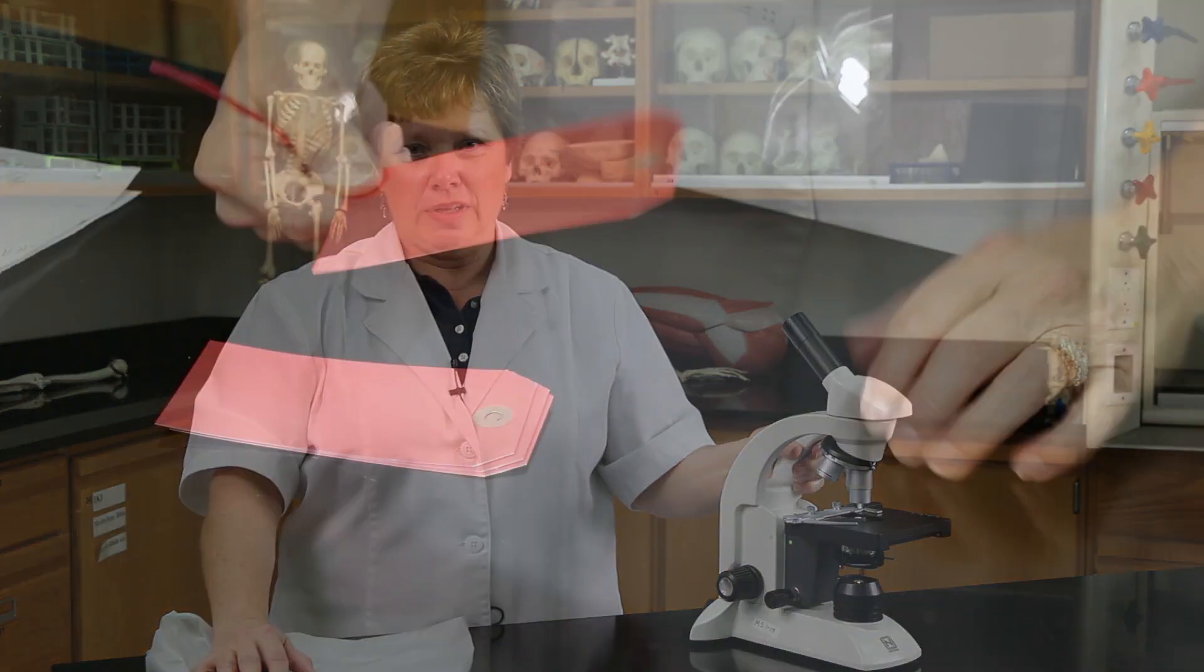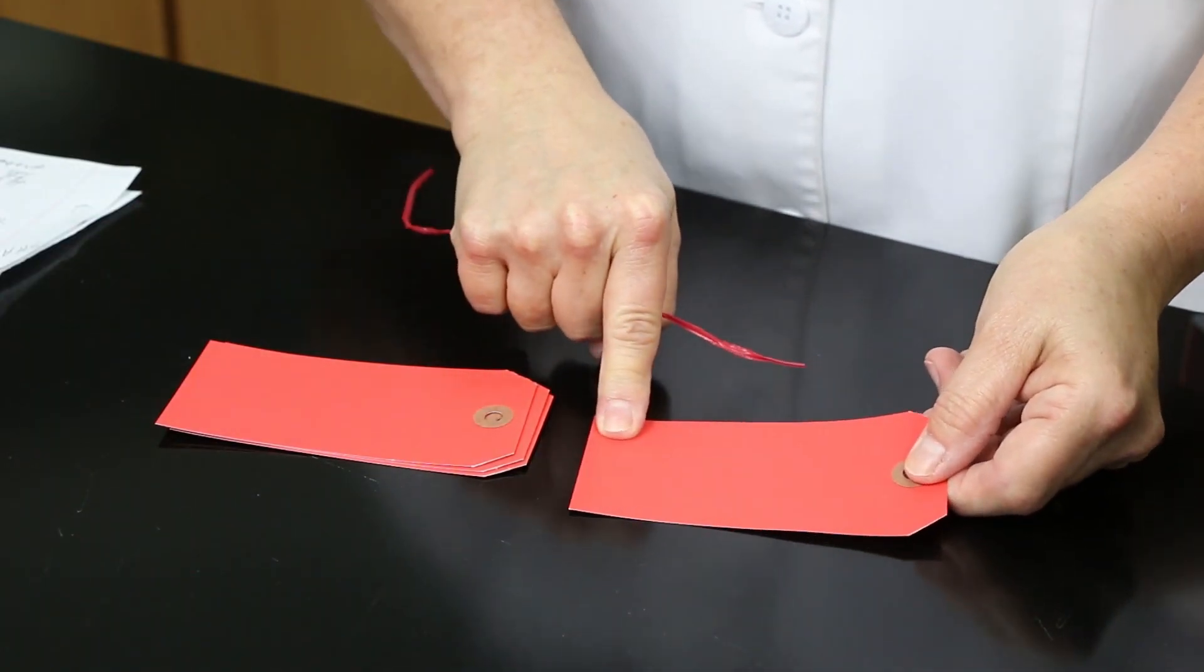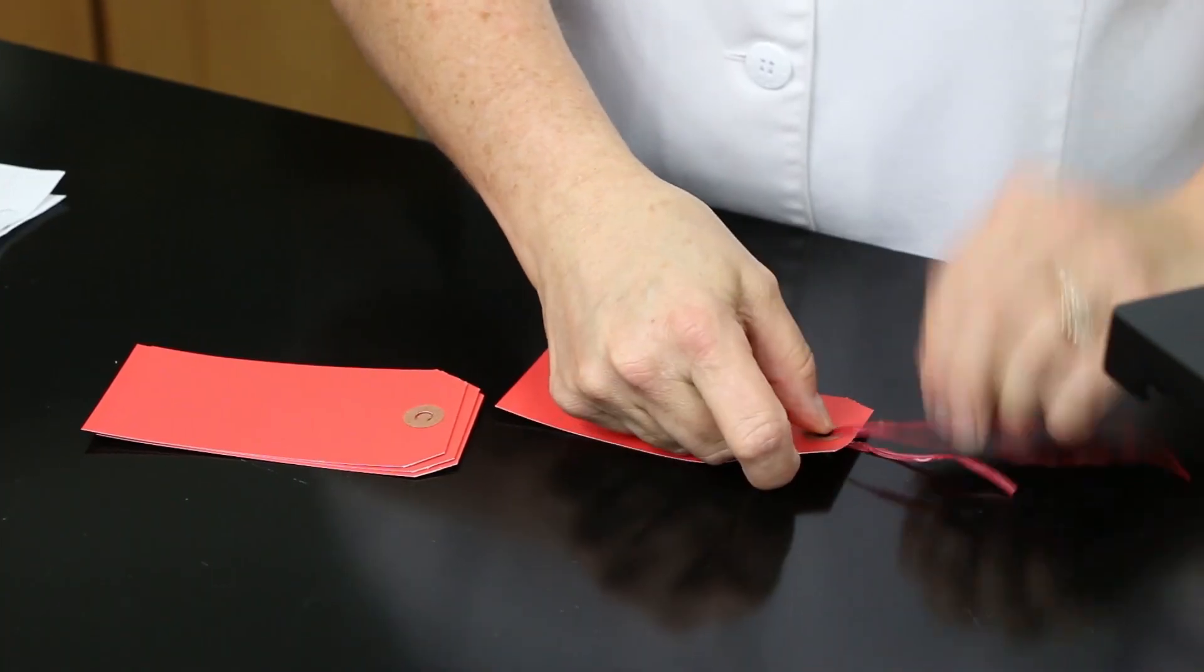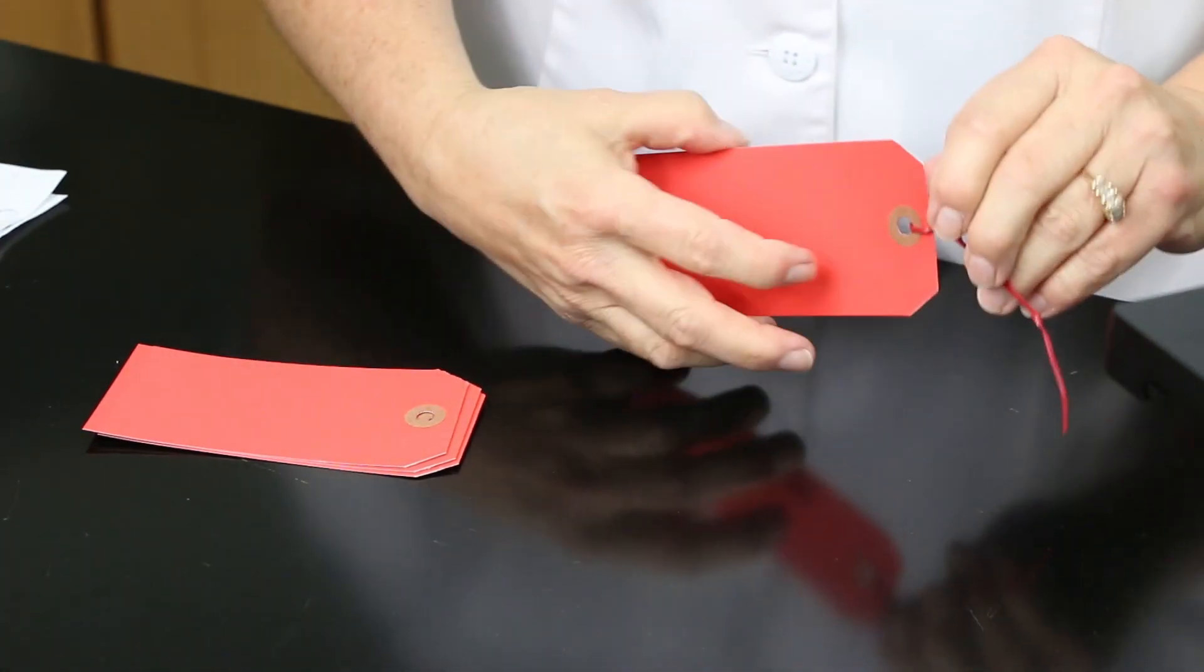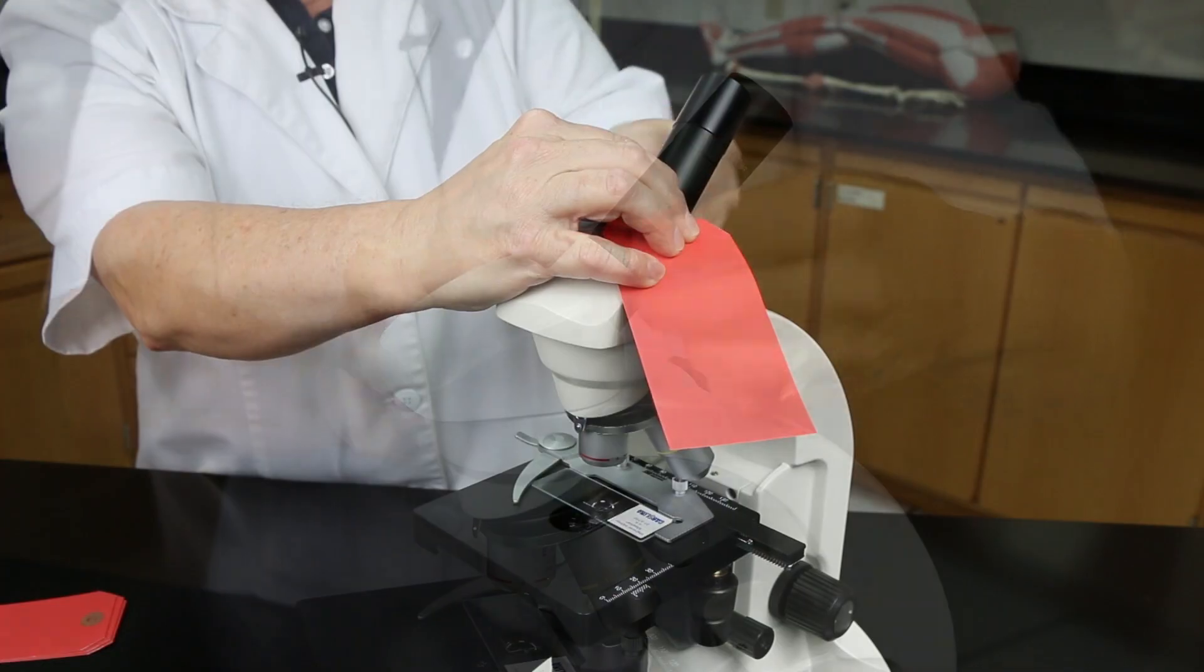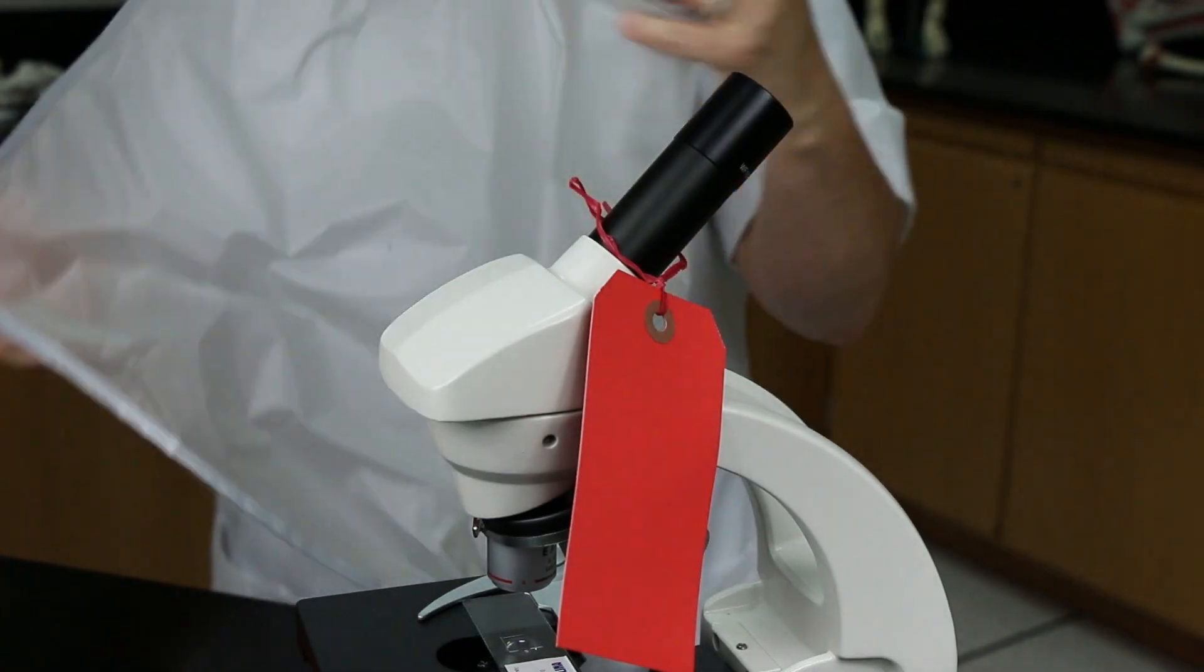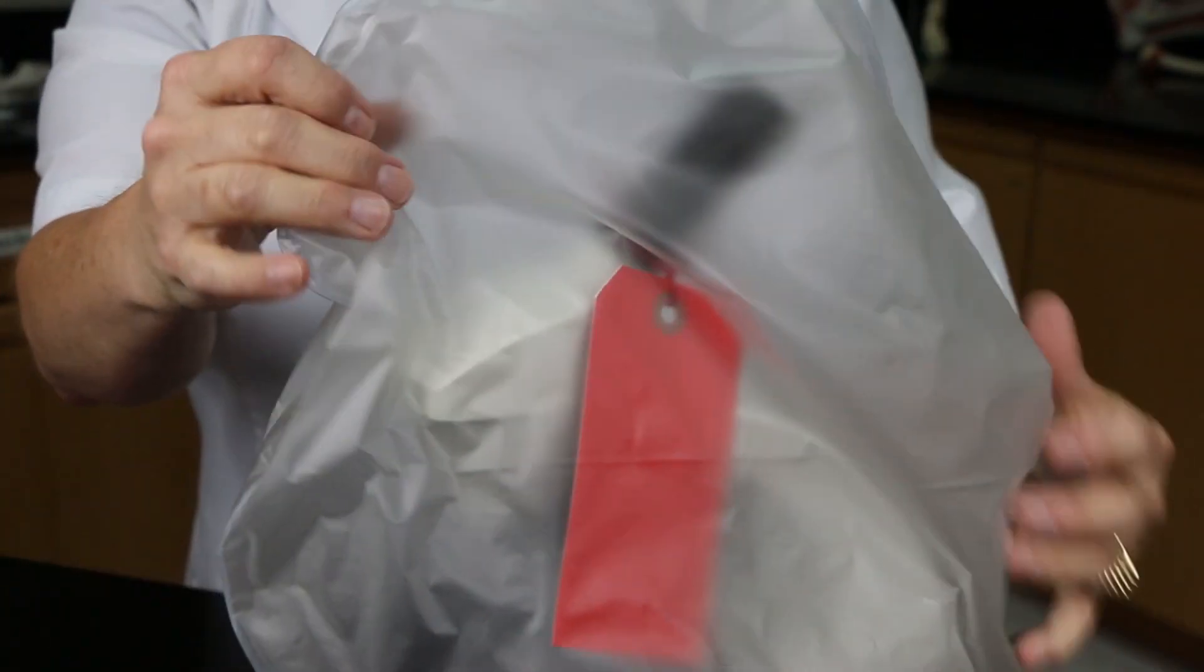When you've done everything you can to make your microscope work, if you still have trouble, put a red tag on it and we'll take a look at it for you. Take one of the red tags that will be located in your lab, write on the blank side what specifically seems to be wrong with your microscope. Use a twist tie to attach the tag. And then affix the red tag to the ocular tube on your microscope. Make sure it's going to stay on, but you don't have to do it tightly. And then once you put on the dust cover, I will still be able to see that there's a red tag and I need to take a look at something.